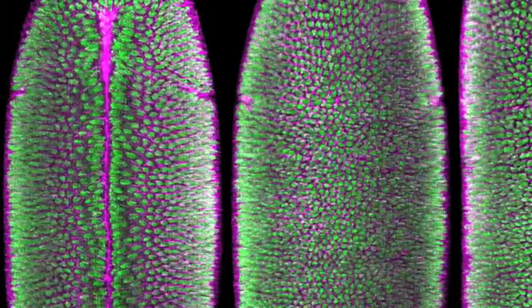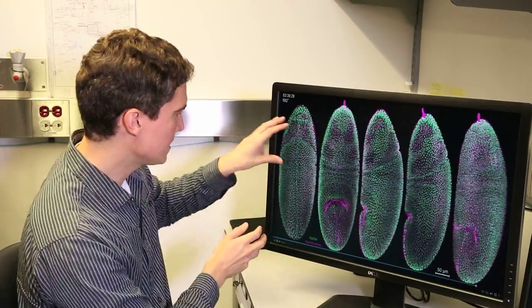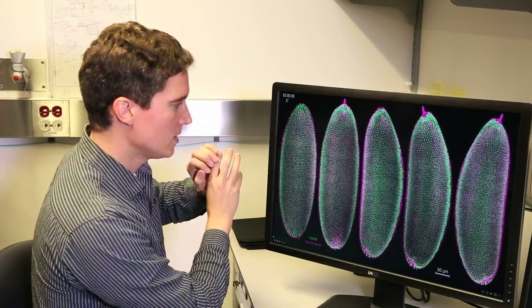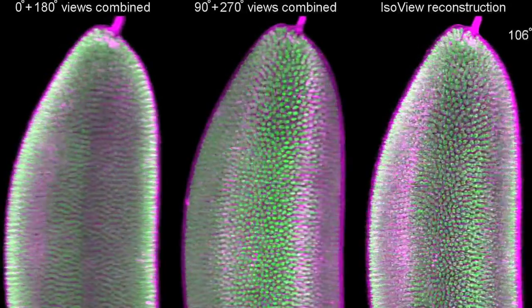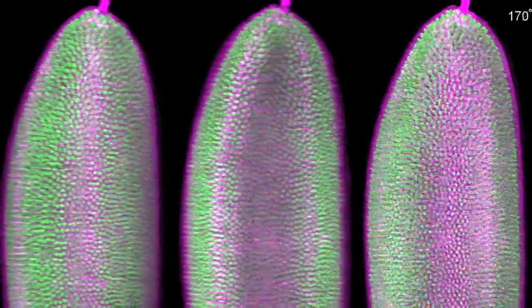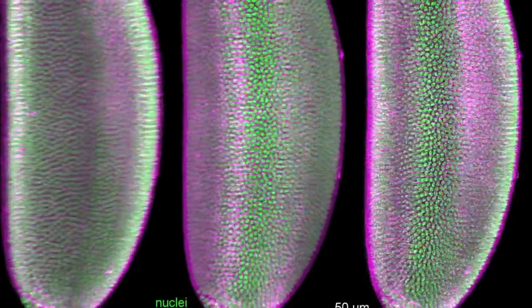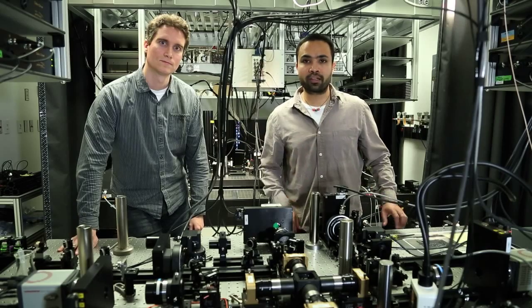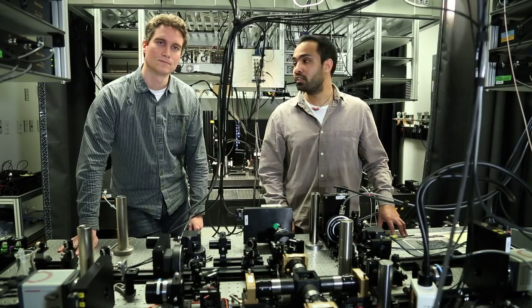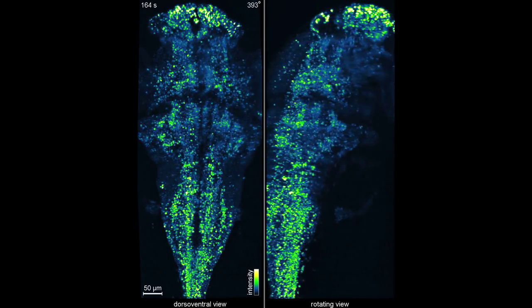The unique strength of the IsoView microscope, also exemplified here in this experiment, is that we get this fairly smooth temporal coverage of this fast dynamic process, while at the same time resolving in space these fairly detailed structures, even at the subcellular level, throughout the embryo in all spatial dimensions. This is an exciting microscope. This is our most powerful microscope in the lab now, and this gives us the opportunity to do experiments that we were unable to do with the previous generations of microscopes in our lab.